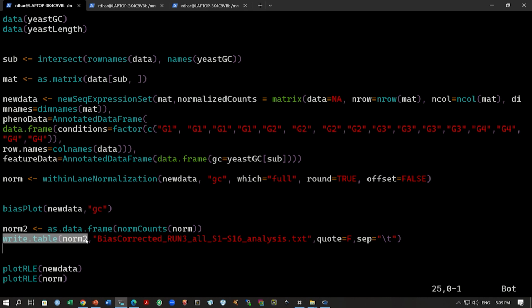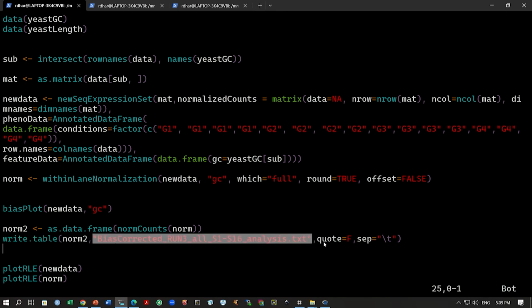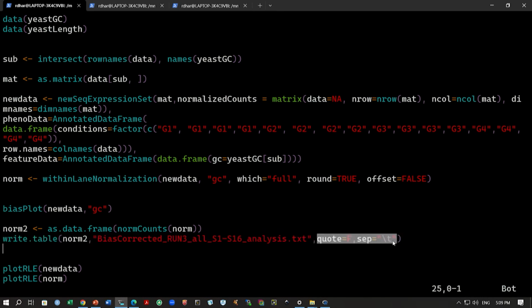This is a very similar command to read.table. Read.table will read the data from a text file, whereas write.table will write this matrix data to a file. You can mention the file name, and then you can tell how it should write this. So, sep equals \t means it should separate every column using tabs. Okay, so we want a tab separated file.